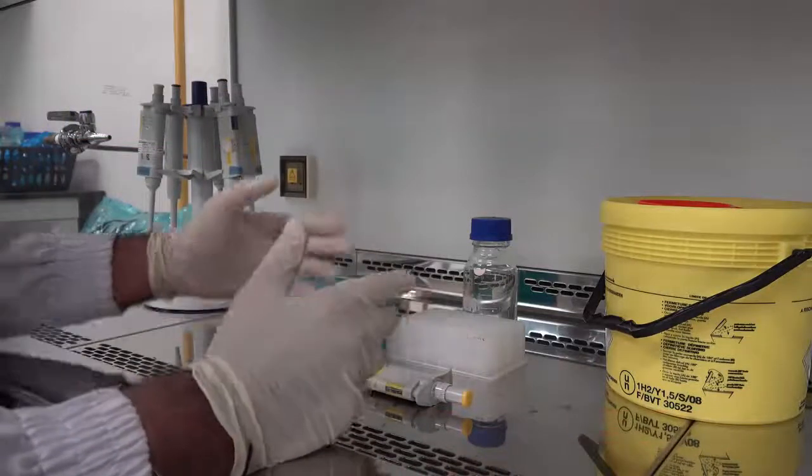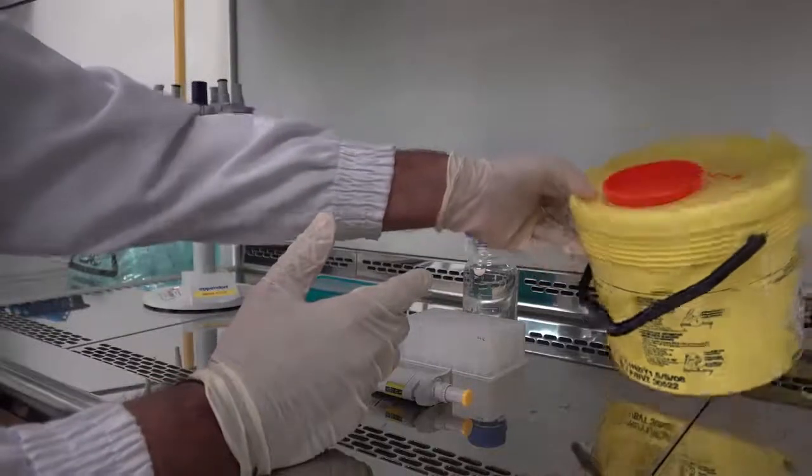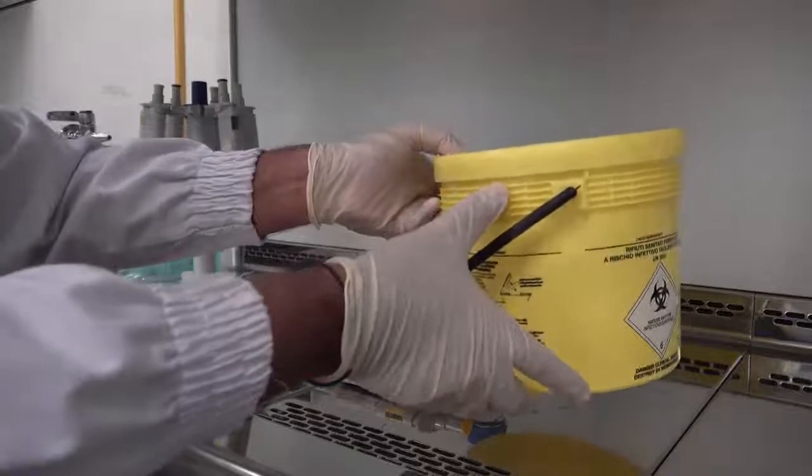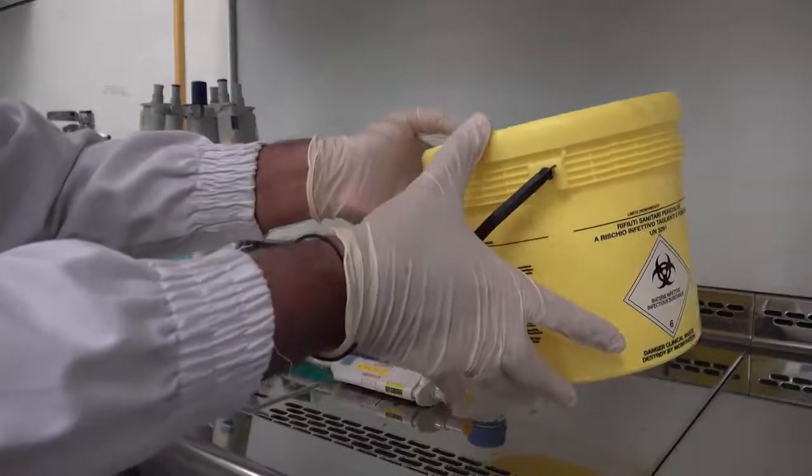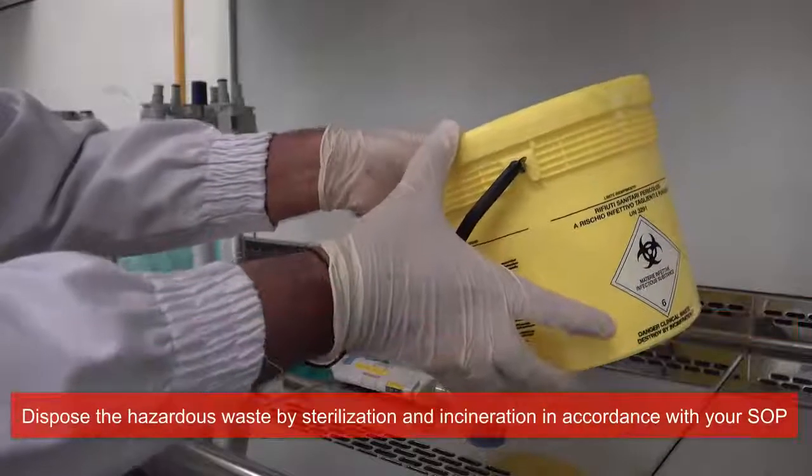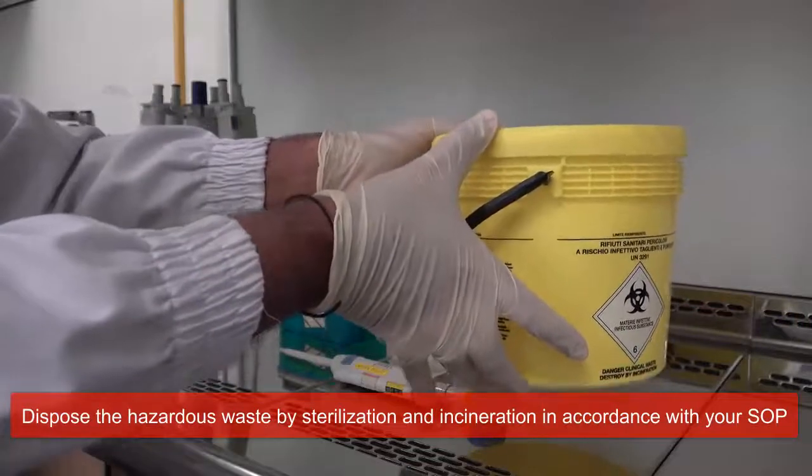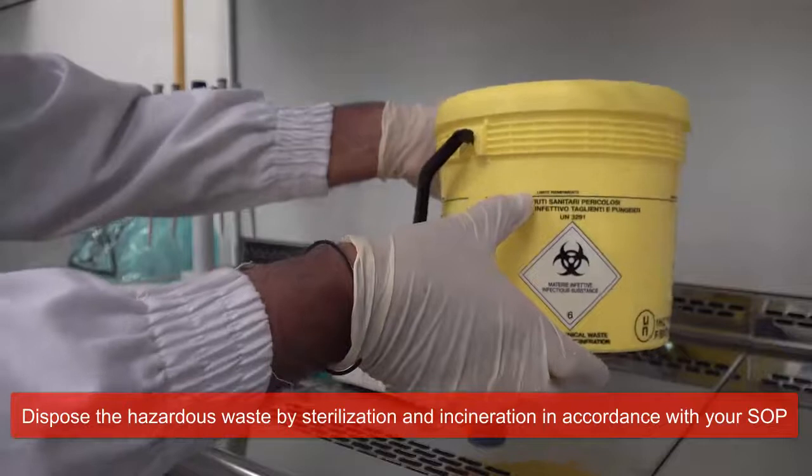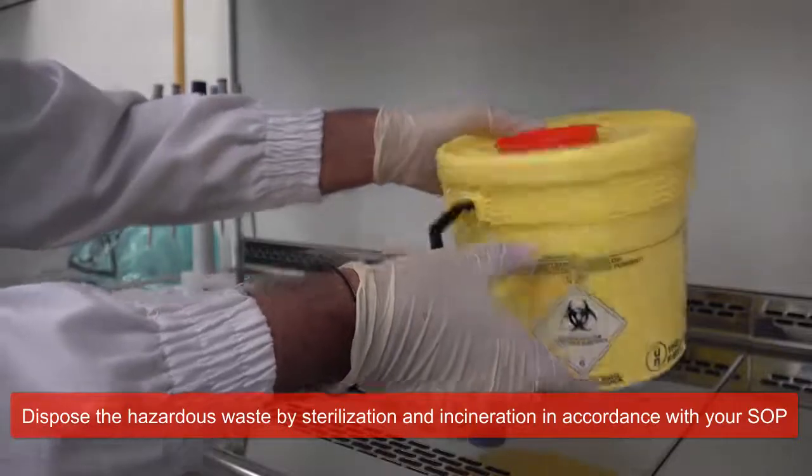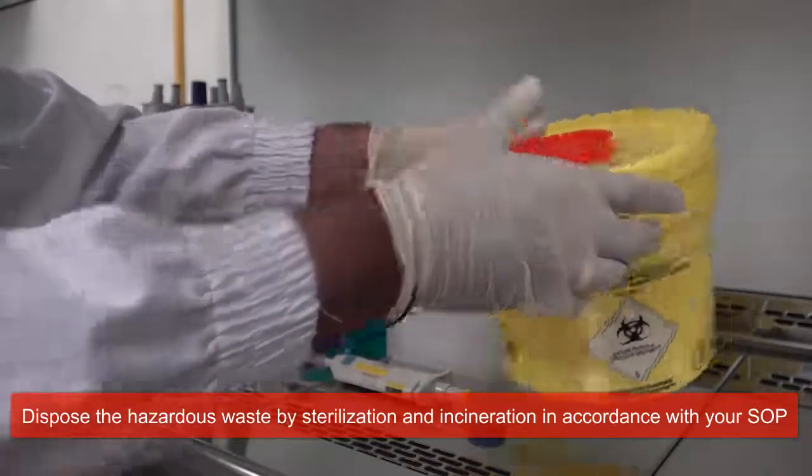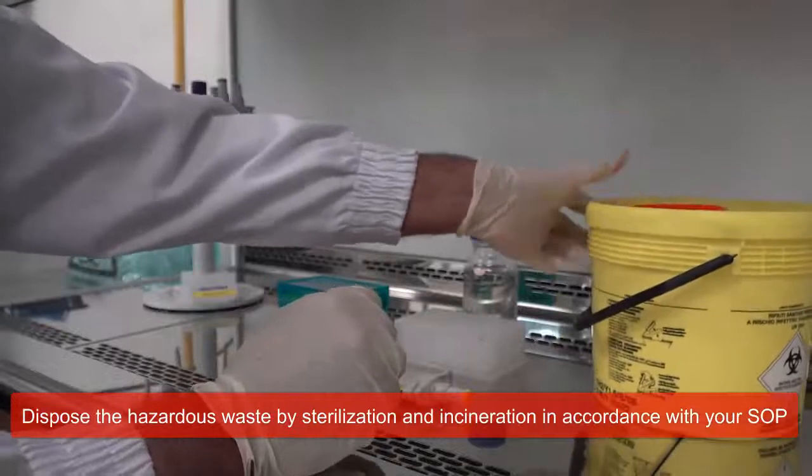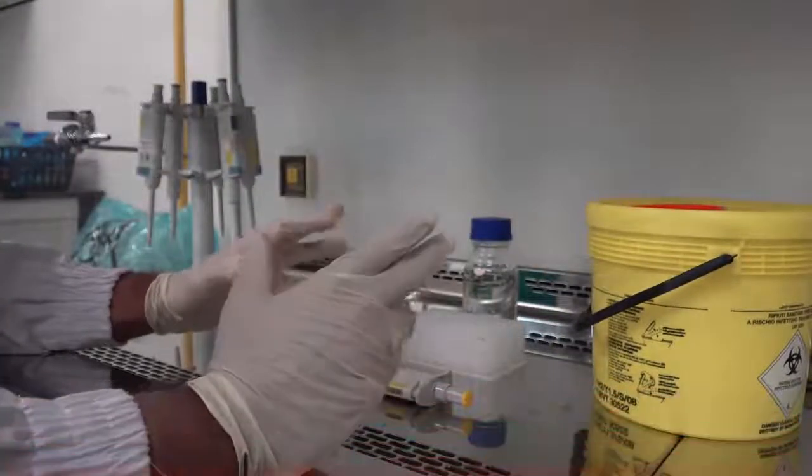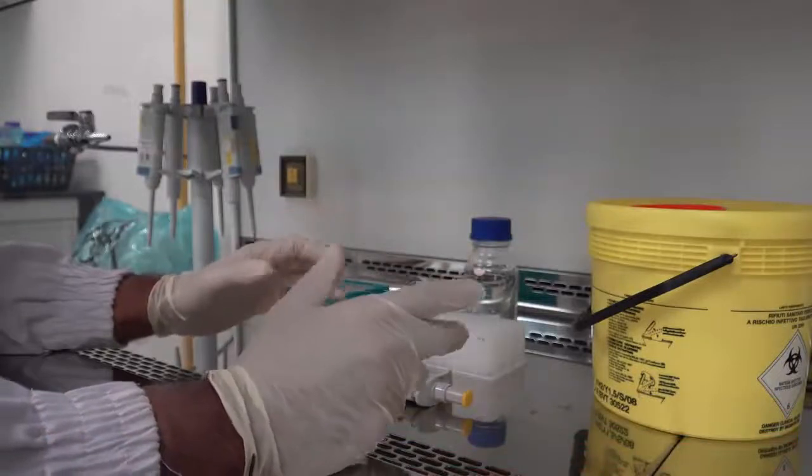So with regard to clean up of this cabinet after use, please ensure that you dispose of this waste bin in a designated area and in accordance with the requisite standard operating procedure when it achieves a level which is two thirds full. This bin has to be sealed and disposed of according to the standard operating procedure which may involve autoclaving or incineration.